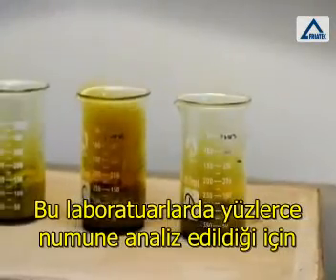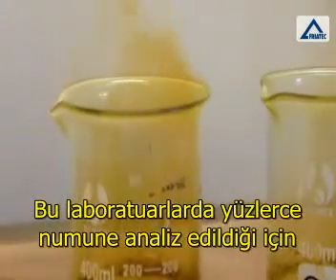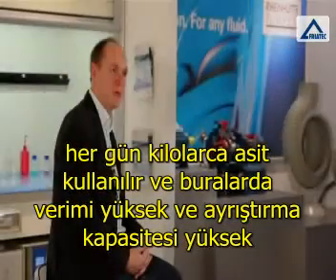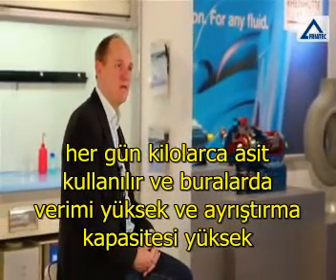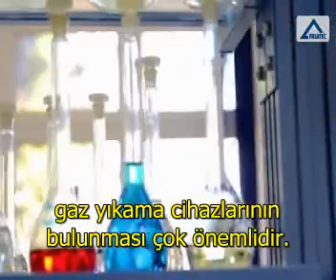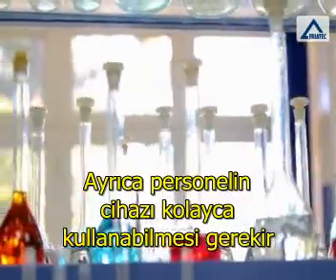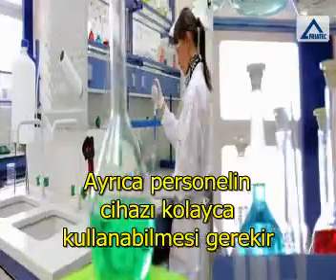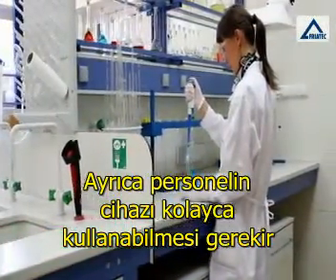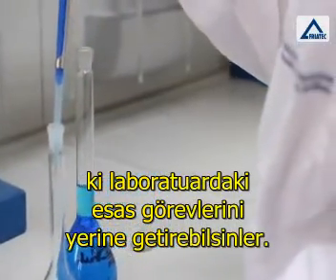They use many kilos of acids per day because they have hundreds of samples to analyze, and in these laboratories it's very urgent to have fume scrubbers with high efficiency and high separation rates. Also, the staff has to be able to operate the fume scrubber very easily because they have to focus on their own work in the laboratory.